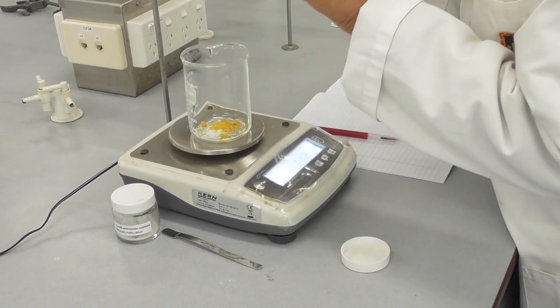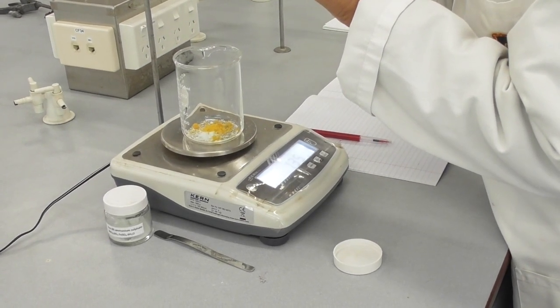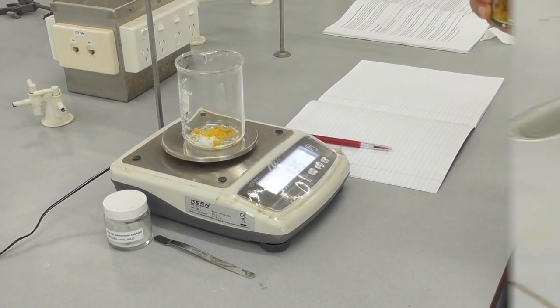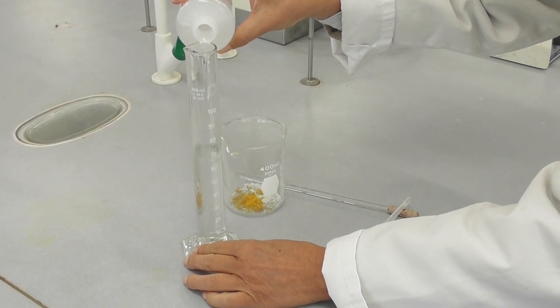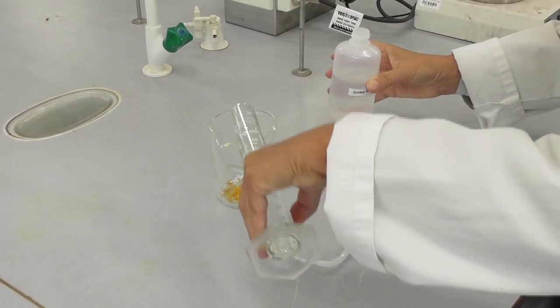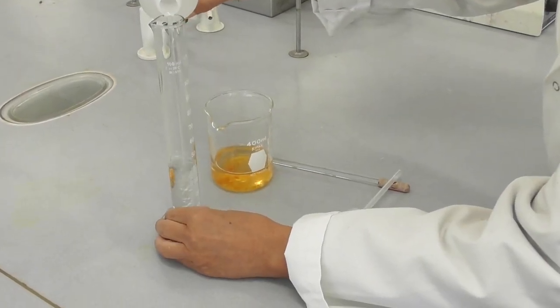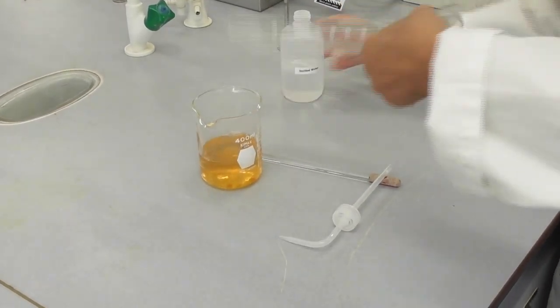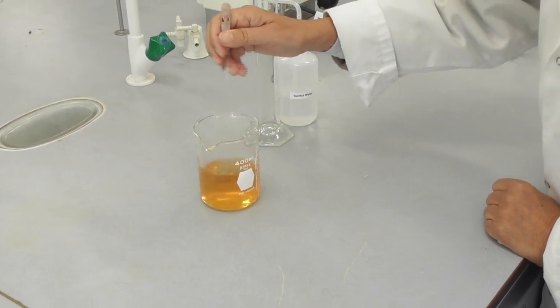I have a mixture of iron 2 and iron 3 salts in my beaker. I add 150 milliliters of distilled water into the beaker and stir the mixture to get a solution.